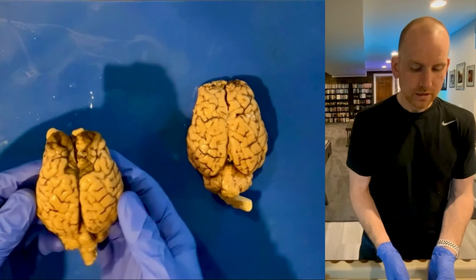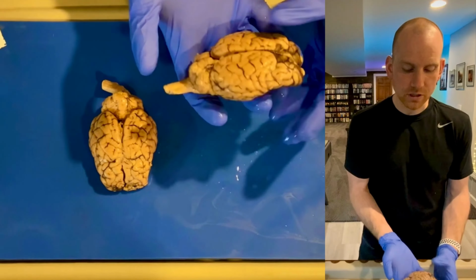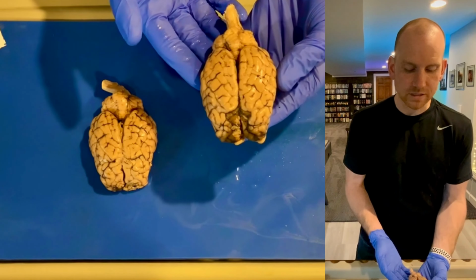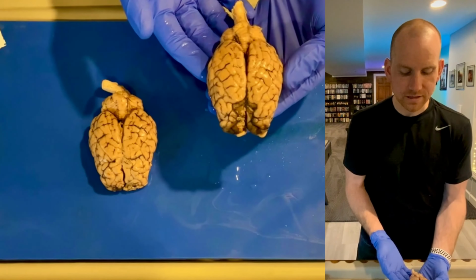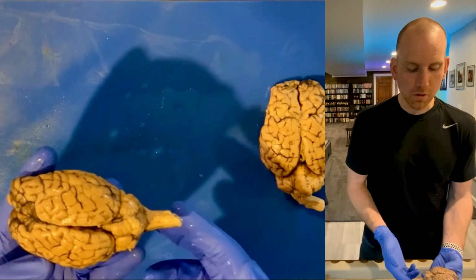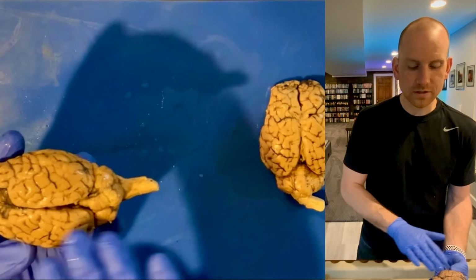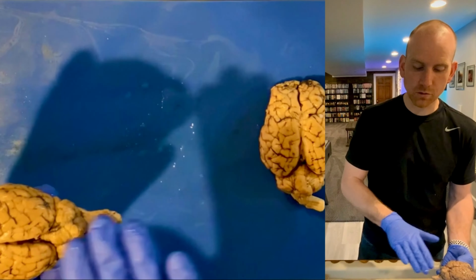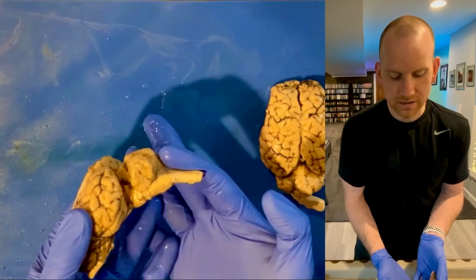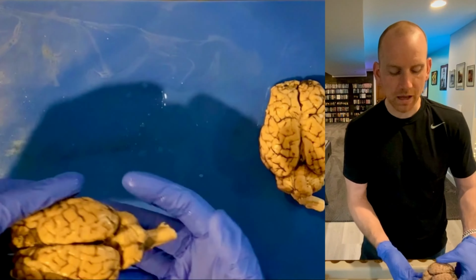do cut it open. So the first thing I want to talk about are some of the differences between a sheep brain and a human brain. And I think one of the first and most obvious differences that you could probably tell based on looking at diagrams as we learn this in class is that sheep are obviously quadruped animals, right? They're on four legs. So their cerebellum and their spinal cord actually lie horizontal, right? Because their spinal cord is going to be going along their back. Whereas for us, ours would actually fall a little bit more like this, right? It would actually fall down. We'd have our cerebellum and stuff below rather than behind.